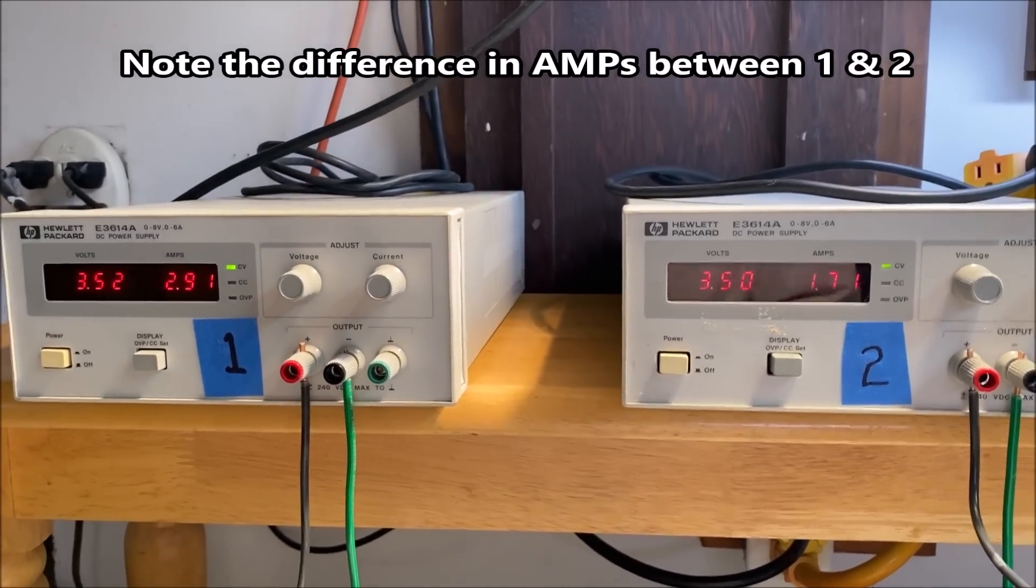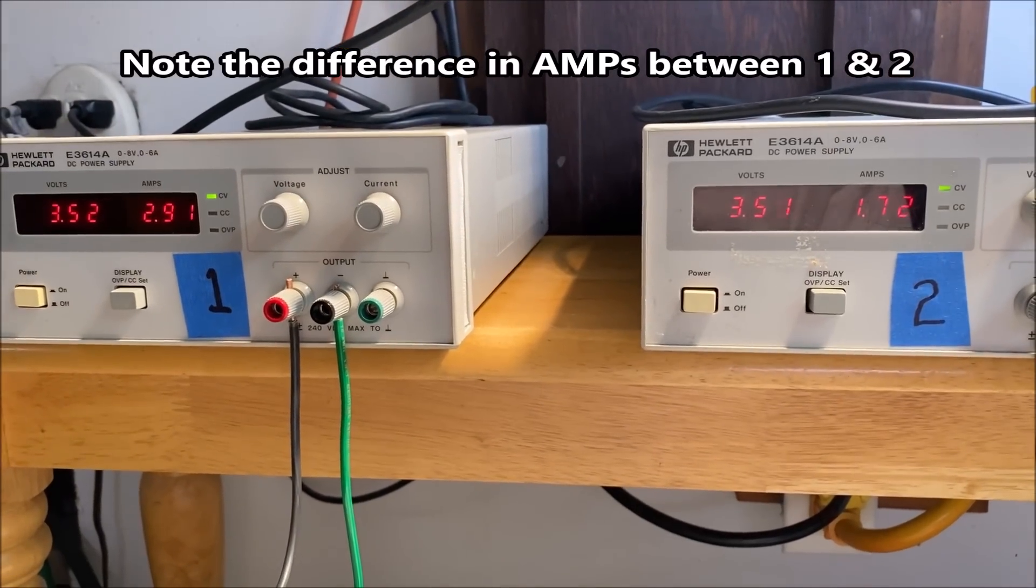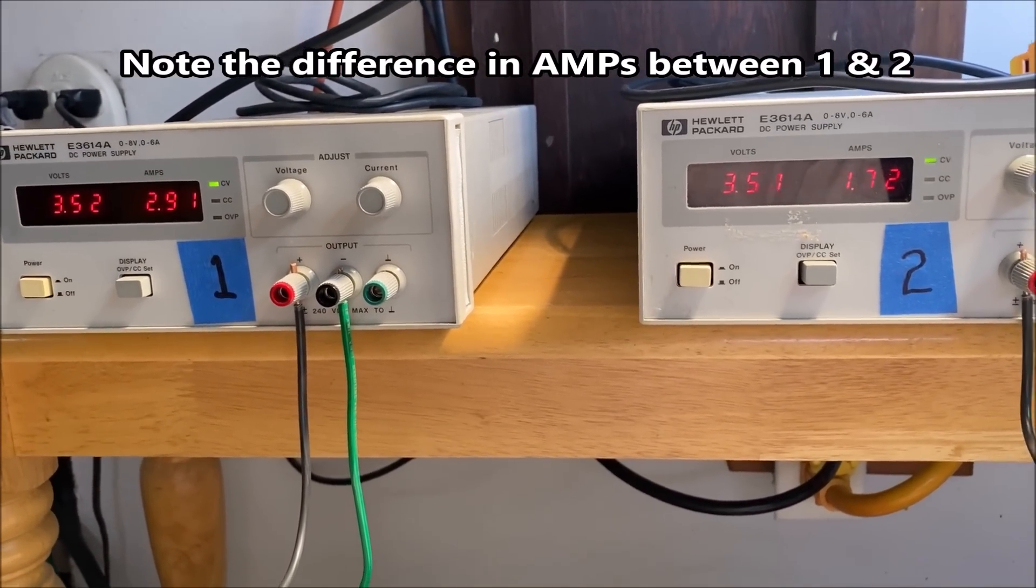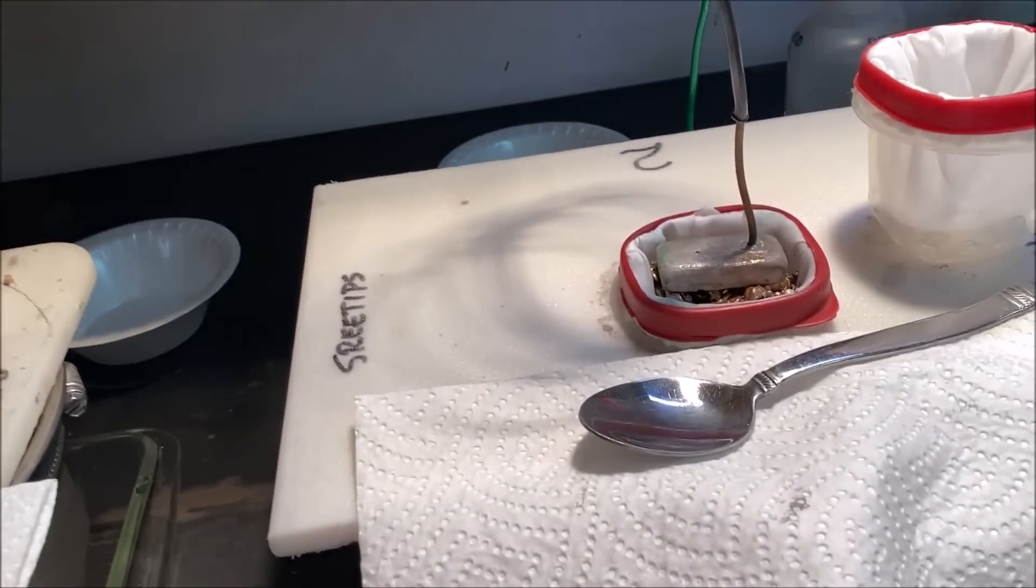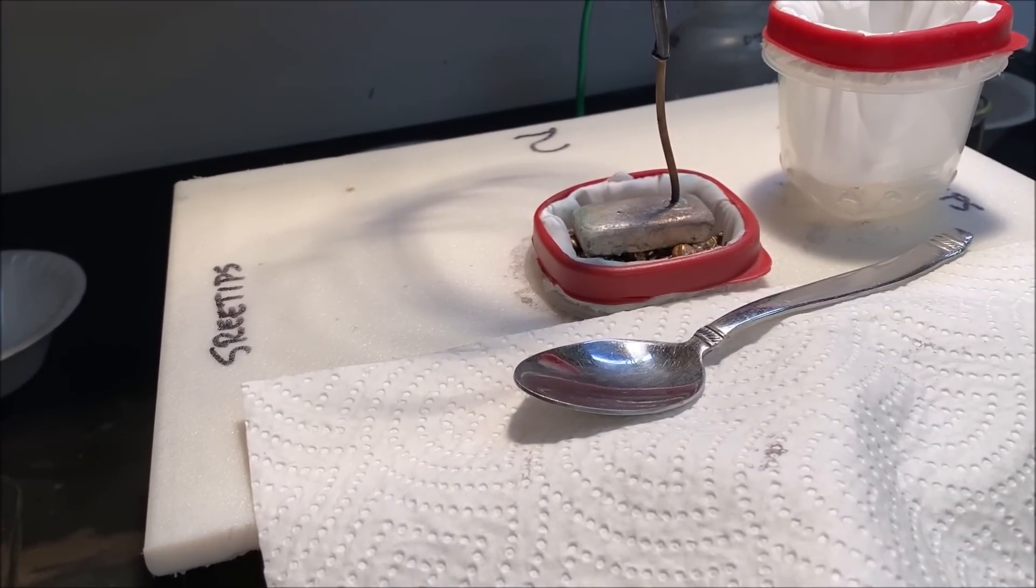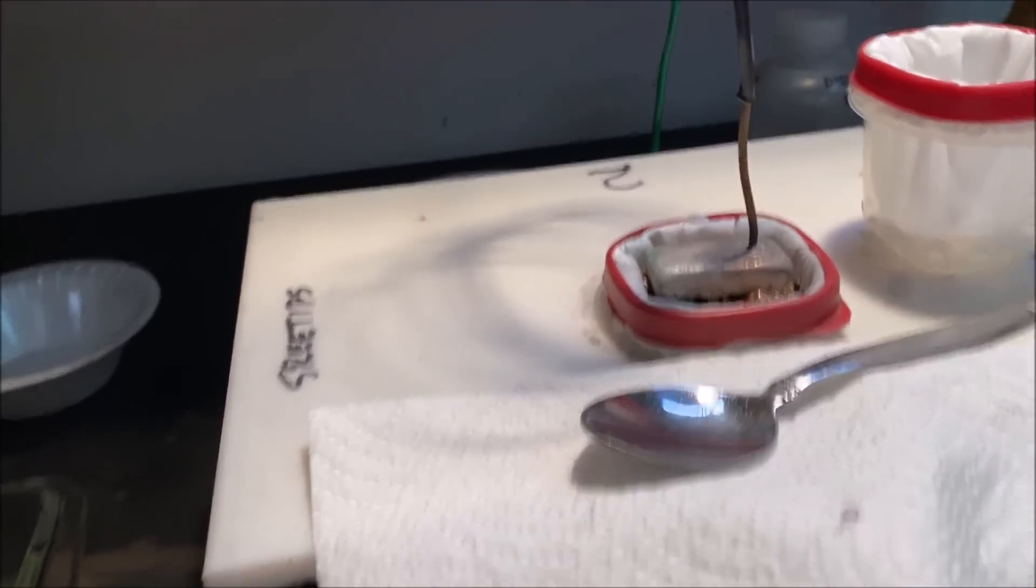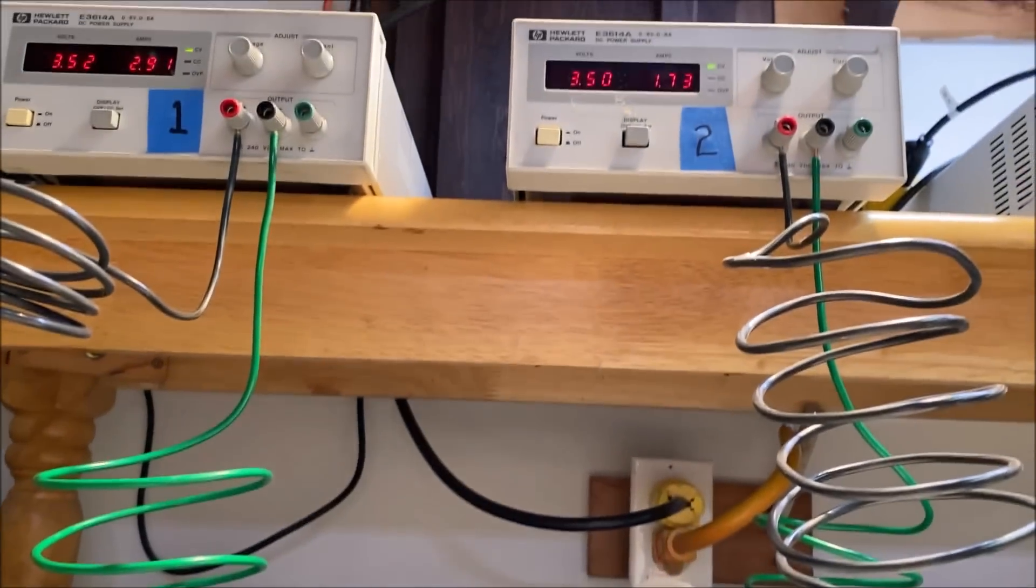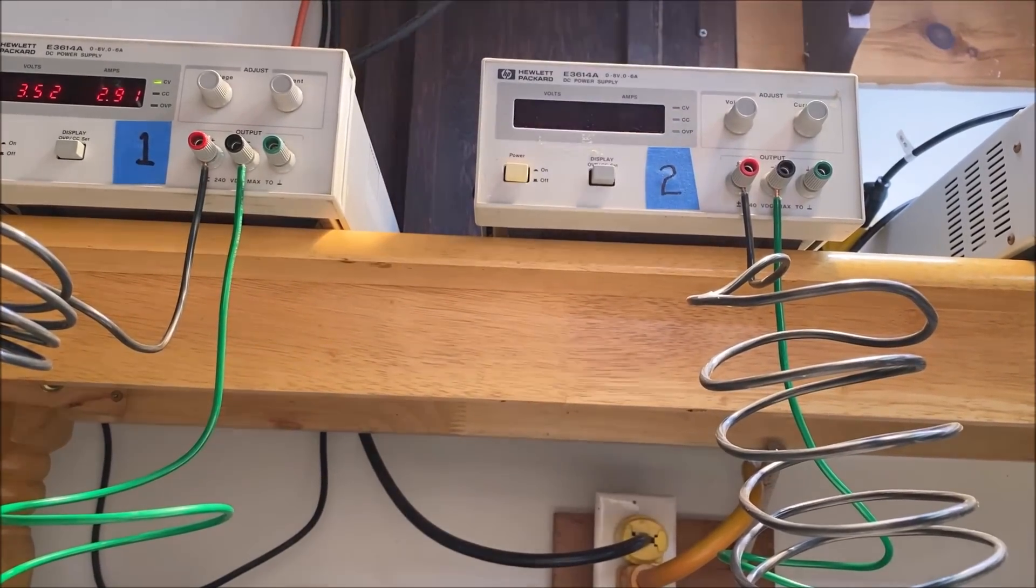We're going to do an experiment. This is one last look at the readings between cell number one and cell number two. So what we're going to do now is I'm going to secure the power supply on cell number two.